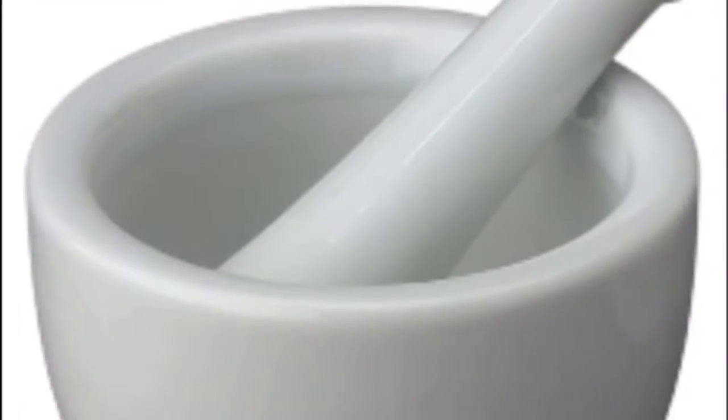Before starting the hydrologic soil experiment, we had to remove brush and rock from the soil to make it easier to handle. We used a mortar and pestle to crush and break the soil down. We then put the dirt in the bottom of the jar and filled it with water. We shook the jar for 1 to 2 minutes and let it settle for about a week to determine what kind of soil was present.